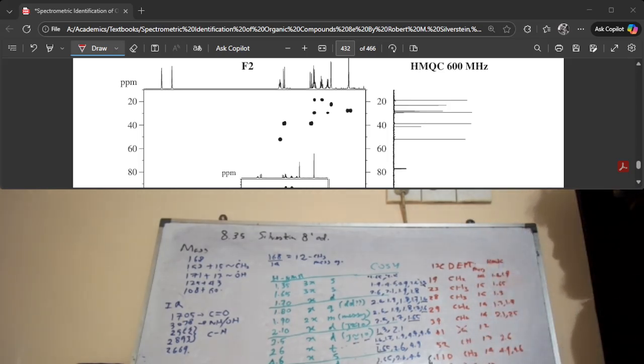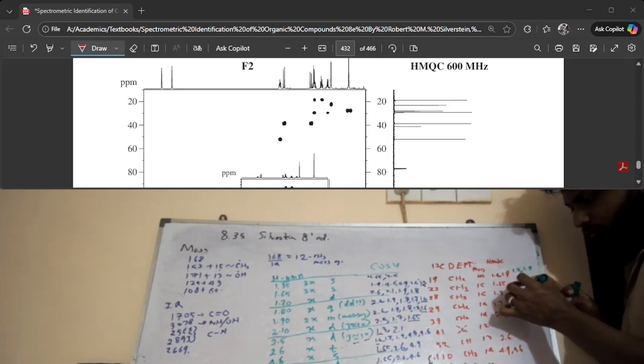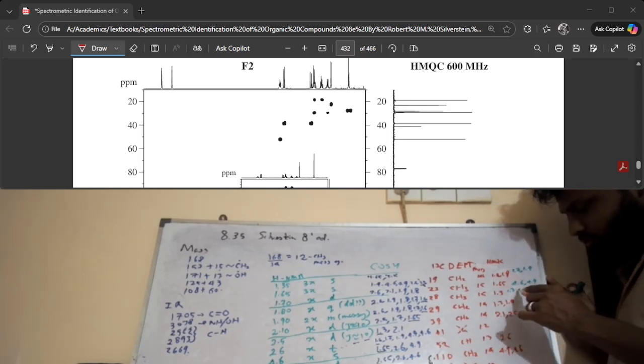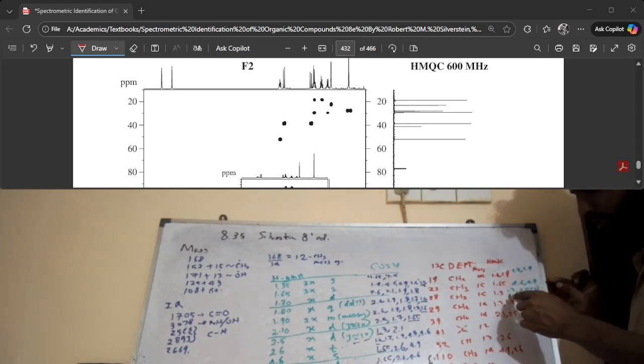The HMBC is critically important in starting to elucidate the structure, right? The HMBC that I have is 1.7, 1.9 for the first proton, 4.6, 4.9 on the second proton, 1.7 second carbon, 1.7, 1.5. If you look at the signal, it looks like two bonds. It's a very intense signal, but you can't be too sure, right? It's 2-1.